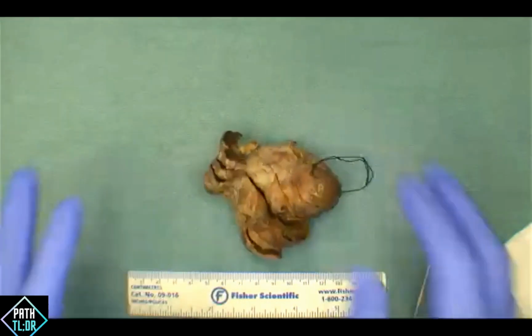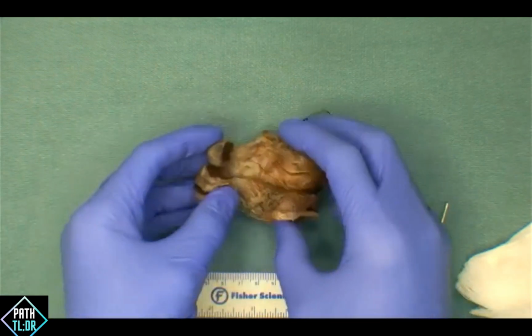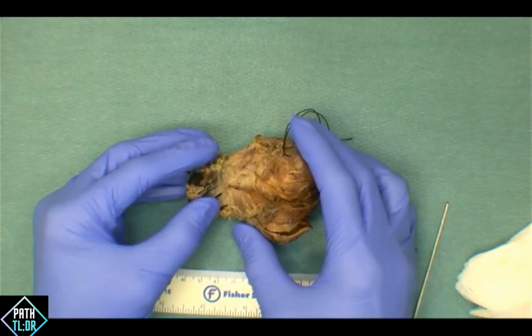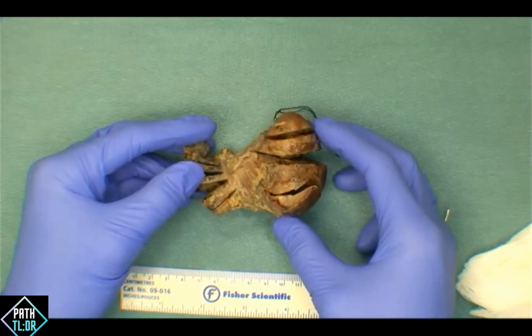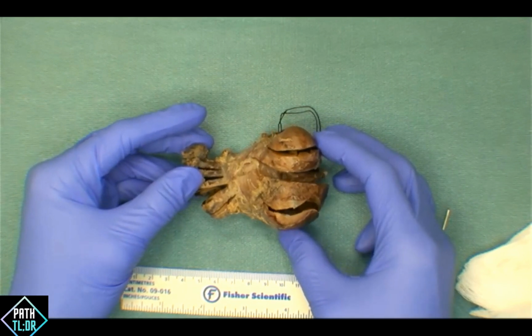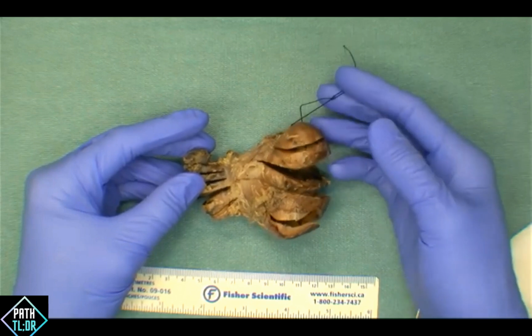When it comes to receiving these specimens, the first thing you want to do is weigh the specimen. All of our thyroid glands are weighed. You want to weigh whole organs. You also want to ink the external surfaces before you start cutting. From there, double check the clinical history and make sure you recognize why the specimen was resected to correlate your findings. And also just always ensure the orientation is correct as it's recorded on the requisition.